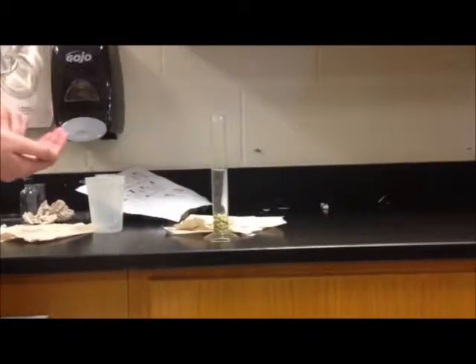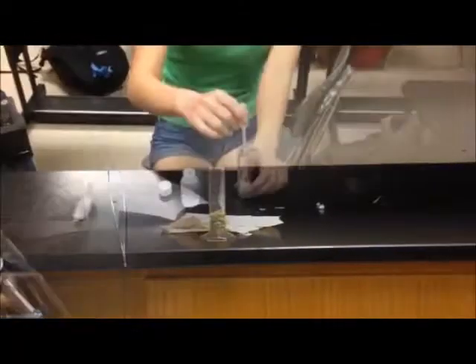In order to make sure each respirometer has the same mass of peas, we use water to measure out 5 milliliters of each molarity solution of peas.